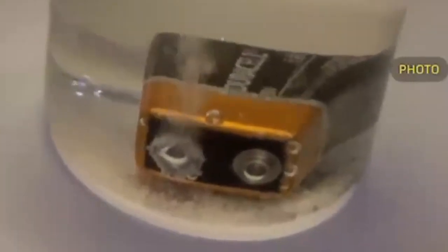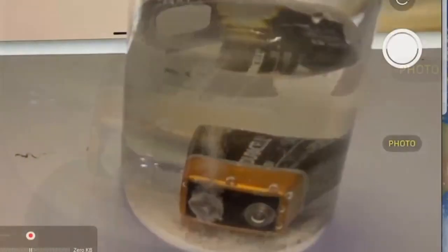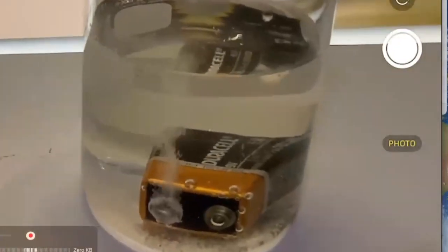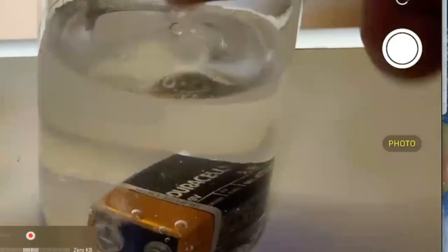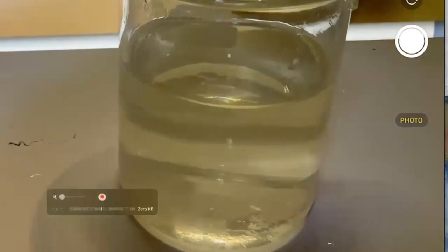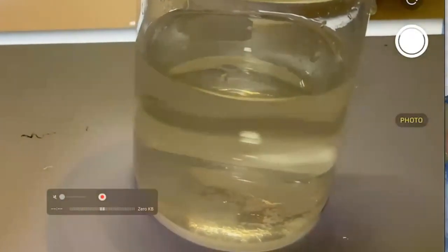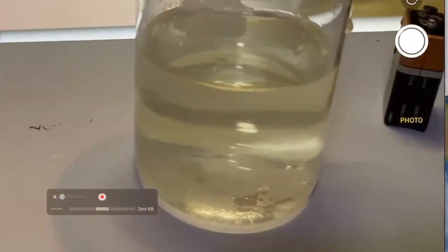What's the formula of water? H2O, 2 hydrogens per 1 oxygen. So you know which side is generating the hydrogen and which part is generating the oxygen. And that's that reaction right there. When you are done, please remove the battery and then dump your water down the sink. You don't want anyone to mess around with it. Dry your battery off and then probably dispose of it at a place like Home Depot. But that's the reaction for this right here.